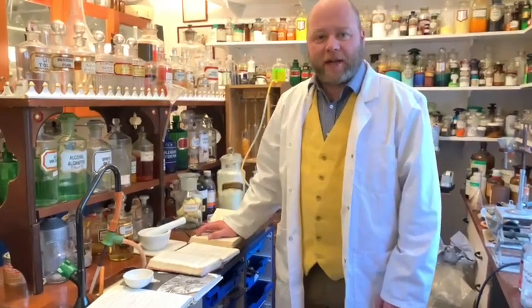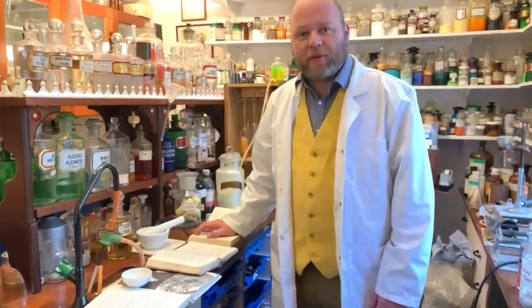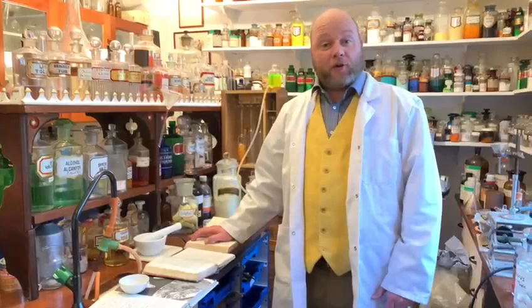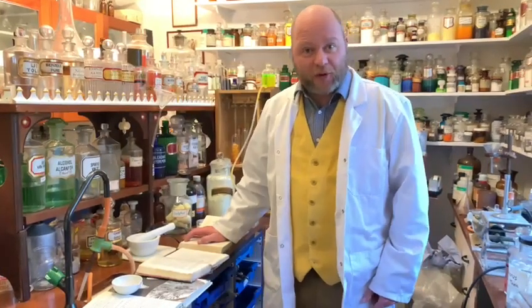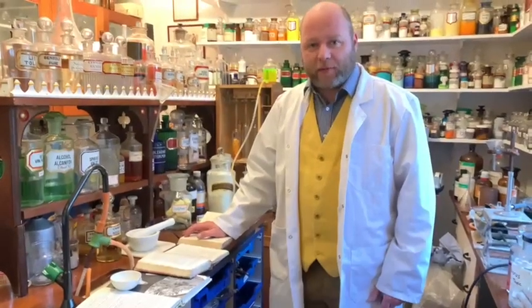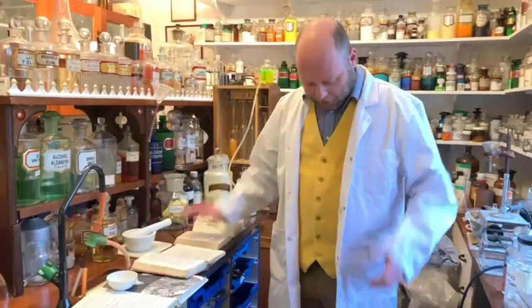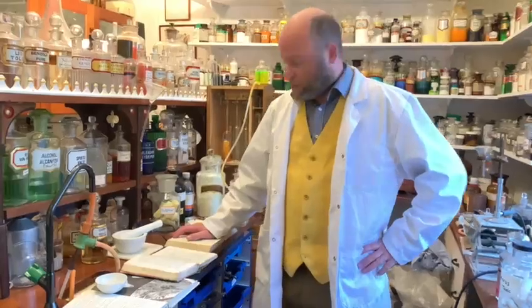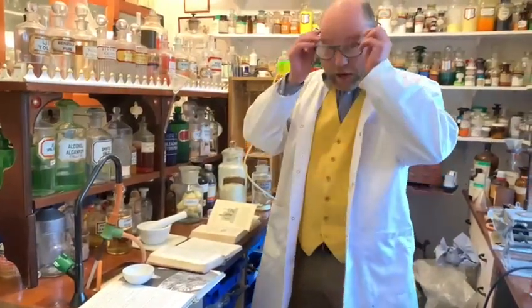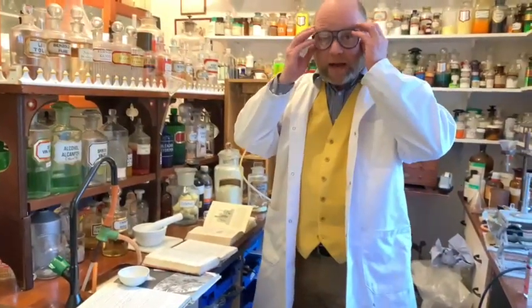Hello, welcome back to Adrian's chemistry laboratory. Unlike Tom in fire and explosions, we're actually going to do some yellow chemistry because we're looking at the element sulfur. In honor of sulfur, I've got my nice sulfur-colored waistcoat. I'll put on my safety goggles and we'll take a quick look at the element sulfur.